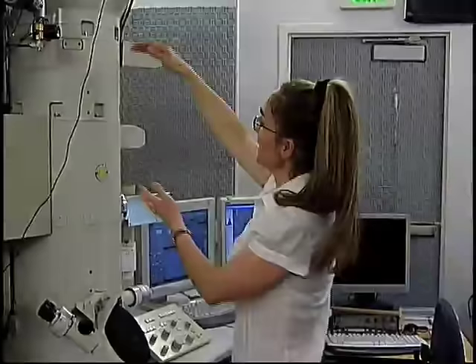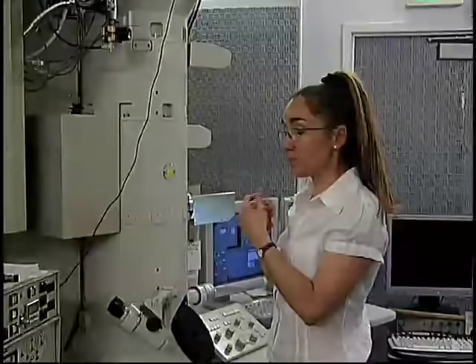The other thing that is very important in this microscope — and the reason why it is so tall that I have to stand on a ladder — is that it has an extra piece: an in-column energy filter. It works very much like a prism, but for electrons. It spreads them out in a rainbow depending on their energy, and that allows us to filter out the inelastically scattered electrons that are contributing only to the noise in the image. This is particularly important when the sample you are looking at are thick sections of thick cells, where the signal is going to be very low and the amount of inelastically scattered electrons is very large, allowing us to clean up the image and visualize things that otherwise would be invisible.